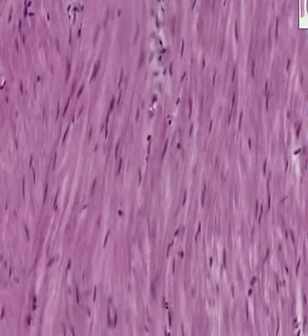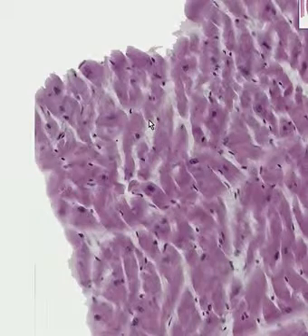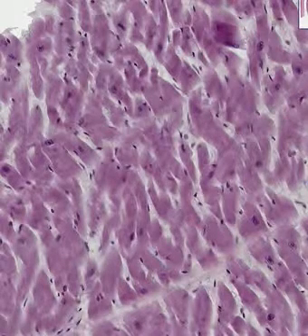Moving away from these smooth muscle fibers now to our third type of muscle. We've just landed on it and we can start to see some muscle fibers in which it's a little bit more difficult to see the striations. Looking at different areas, perhaps here, or here — I hope I can convince you that these are striations also.